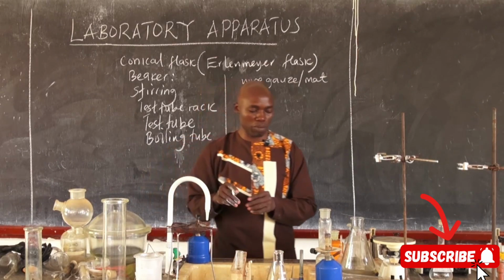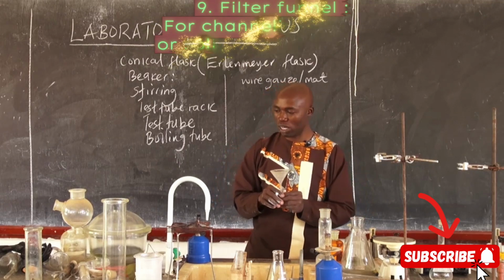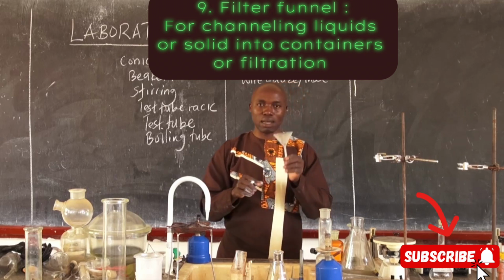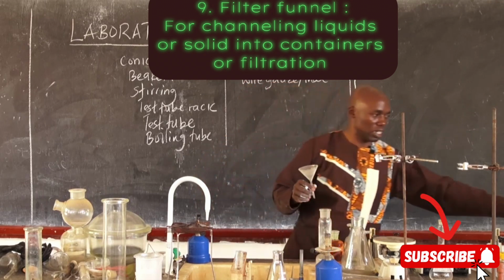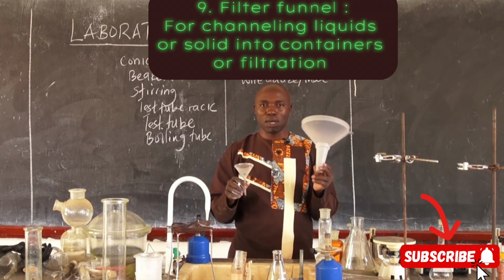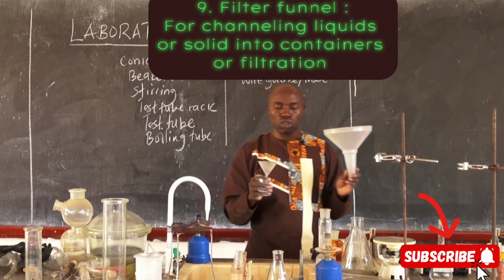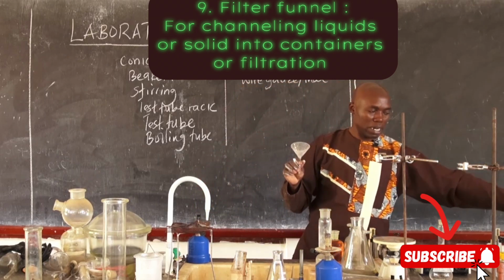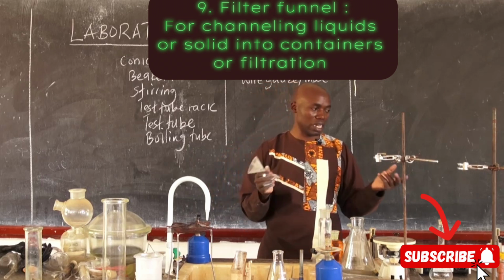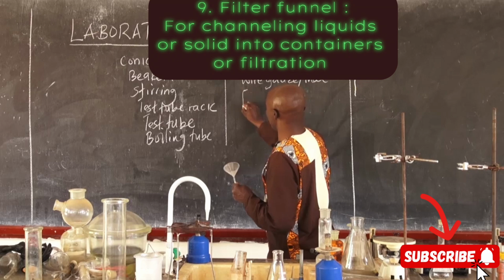So then I have in my hand what I call a funnel. Normally funnels come in various sizes. We can have those that are plastic and those that are glass. So depending on the purpose, we use the funnel. Always, glass apparatus are very expensive. That's why in most of our laboratories we encourage using the plastic apparatus. So the funnel is called a filter funnel.